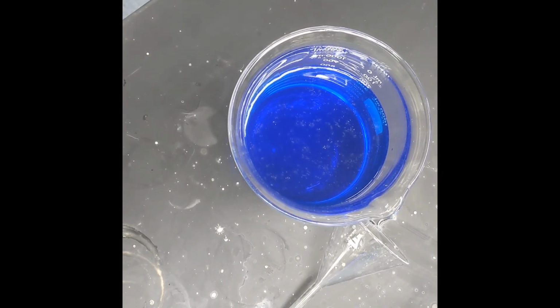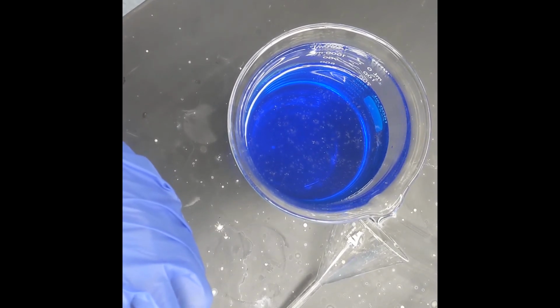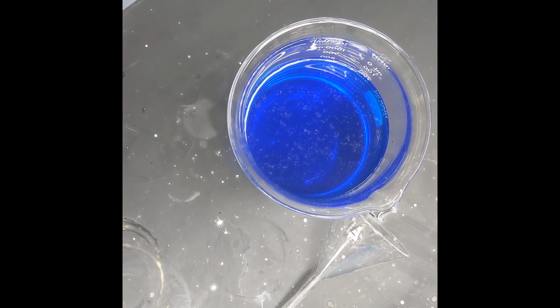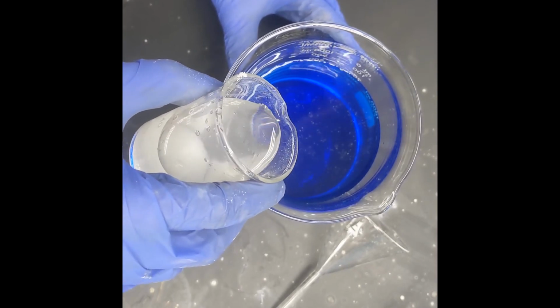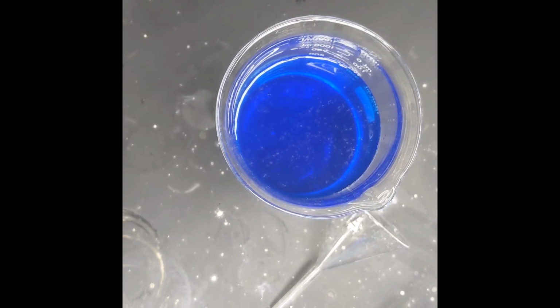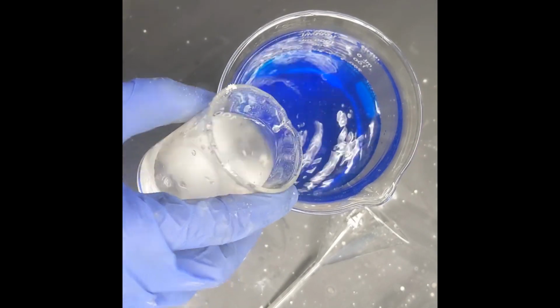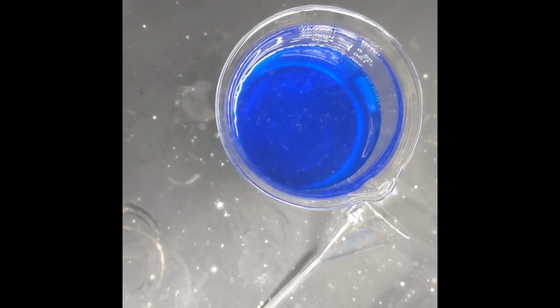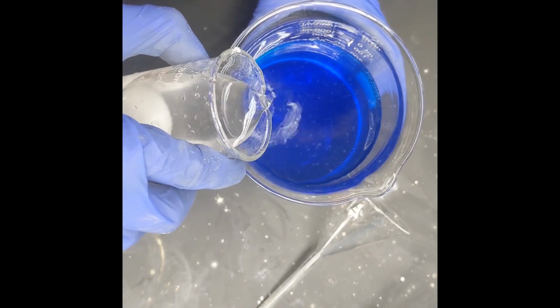And just a reminder, what will happen if there is, we will get a white precipitate when the sodium chloride, which contains just chloride, reacts with the silver nitrate to make silver chloride. Place your bets. Oh, wow. Nothing at all. If there was any remaining silver at all, we would see a very, very evident white precipitate. And there was nothing, which is great. That means we got all of the silver out. We just did a terrible job of separating it from everything else.